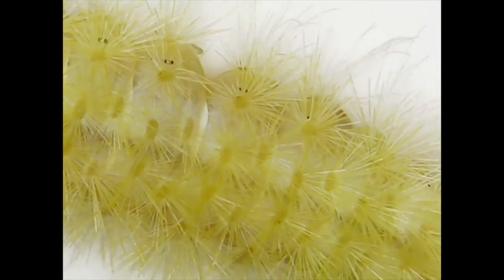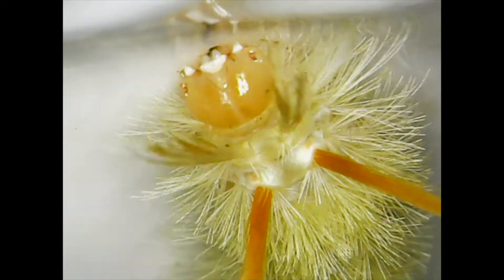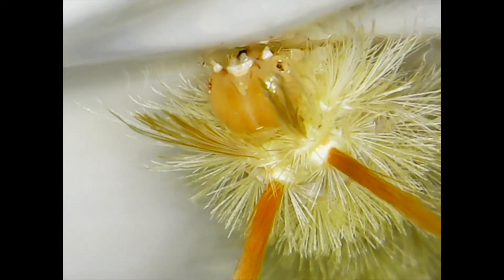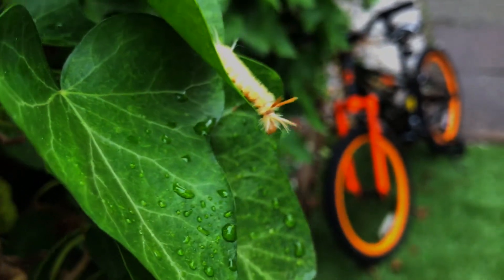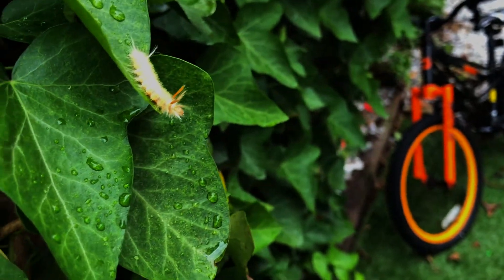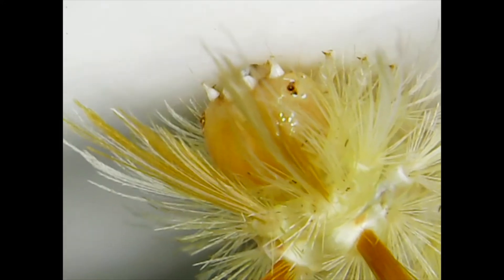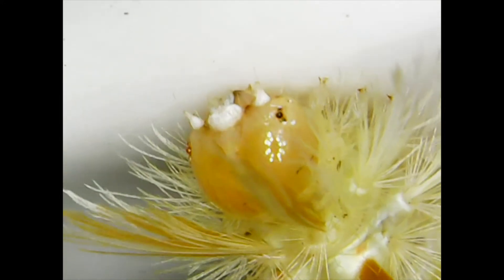This sycamore tussock caterpillar has white fur and an orange head. It also has four longer tufts of orange hair on its head and white tufts of long hair on its tail.